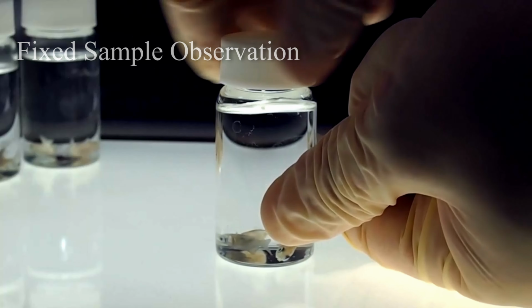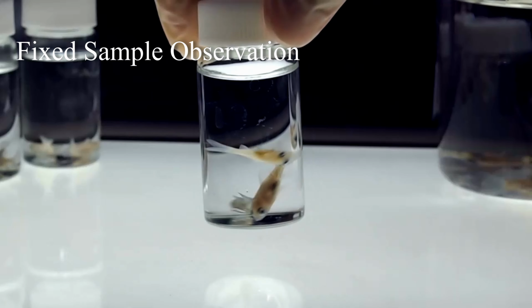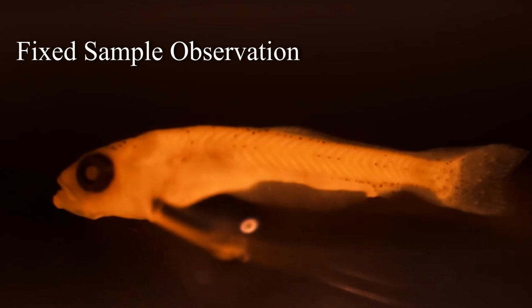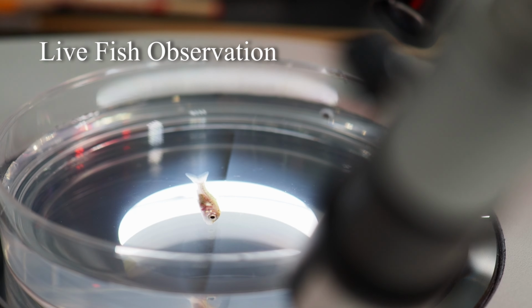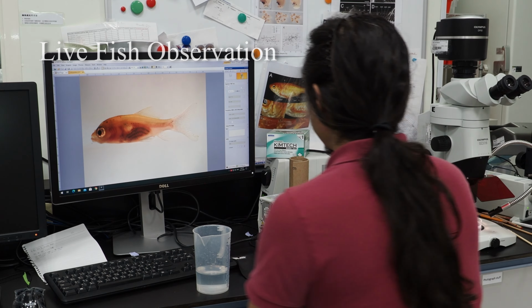One method involves anesthetizing the fish, fixing them with a fixative to preserve them in a lifelike state, and then carefully observing them later. The other method involves photographing the live fish and keeping records.